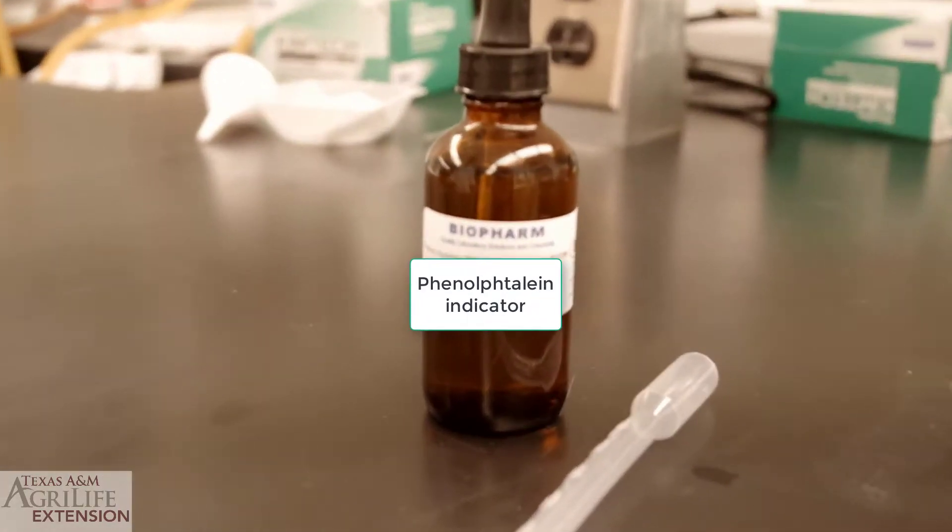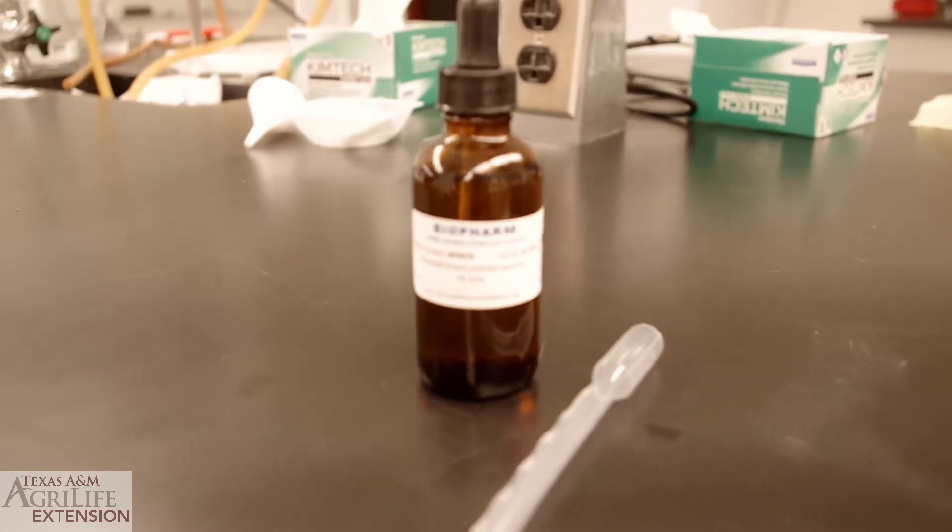We start by adding a few drops of phenolphthalein indicator to our sample.